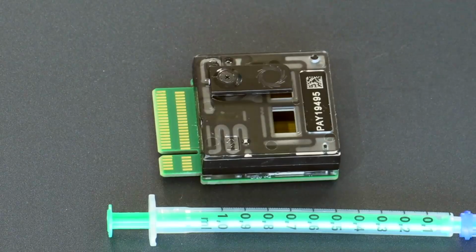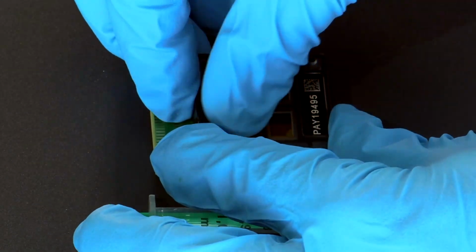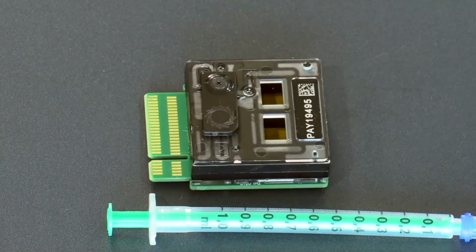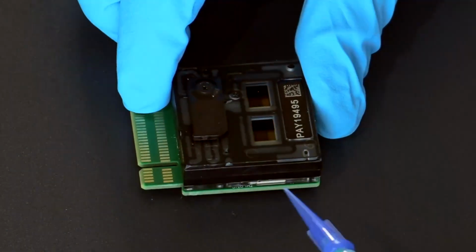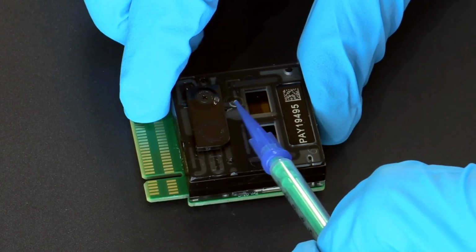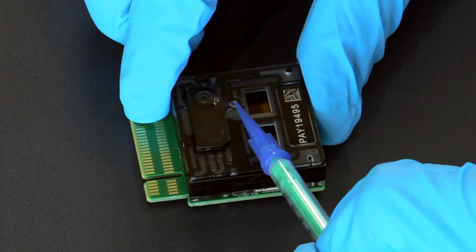Now, as a very first step, if you remember correctly, the first step to do on the flow cell loading side, we need to open up the priming port cover to expose the priming port, and we can already see that the priming port itself has a gray colored channel next to it.